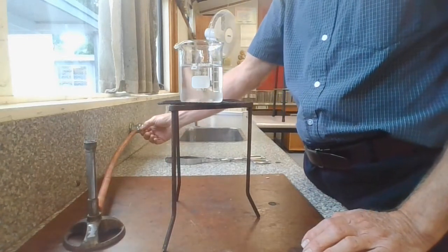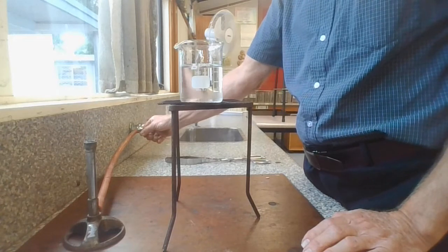When you've finished heating, you turn off the gas. You do not blow the Bunsen out.